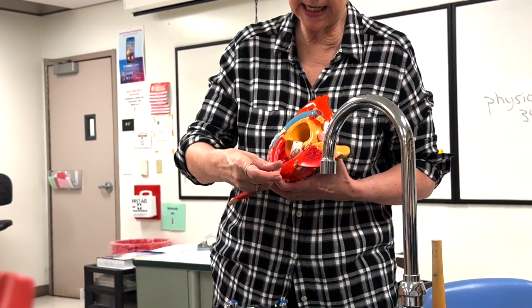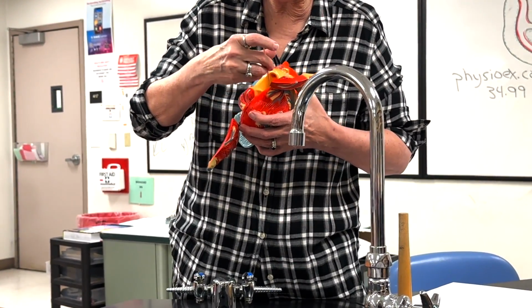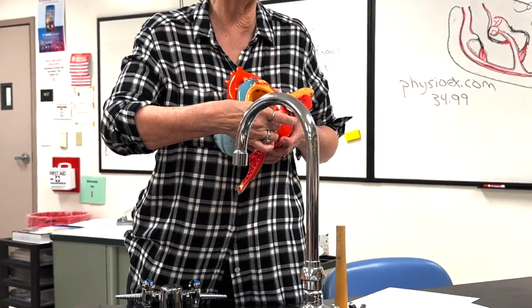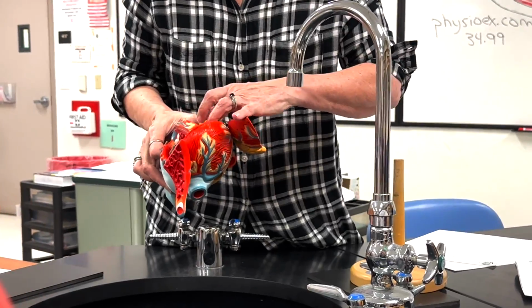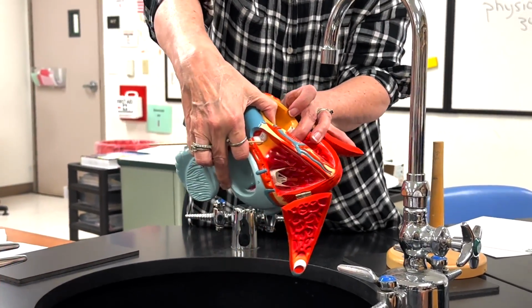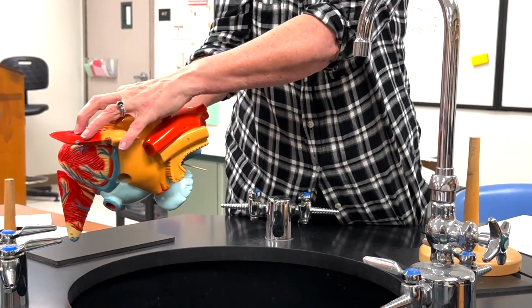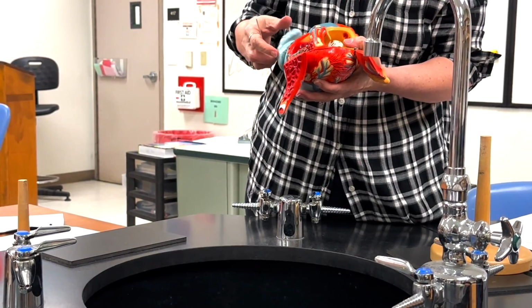All right, once the left ventricle is pumping, it goes out the aorta, which is tucked up under here, kind of behind the AV valve. So if you look up in there, you'll see the semilunar valve for the aorta. Okay. All right, and then blood goes to the body.